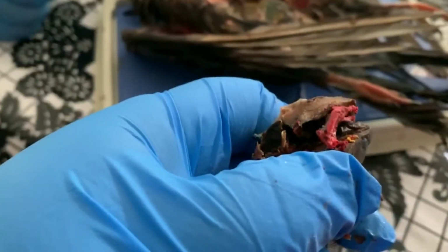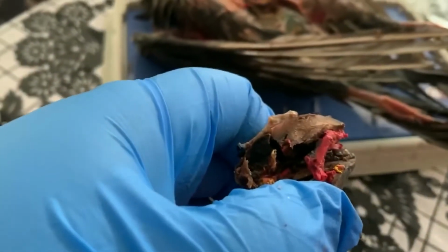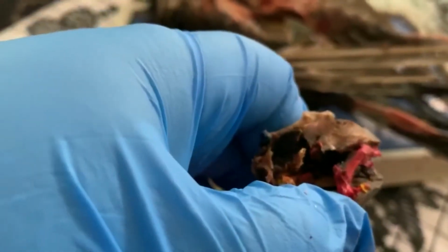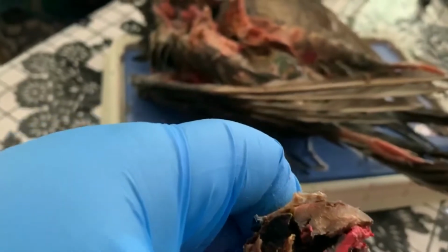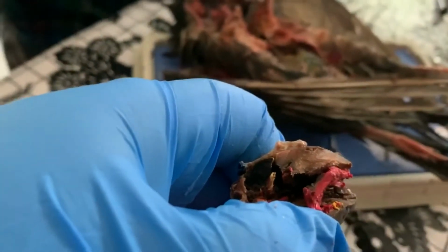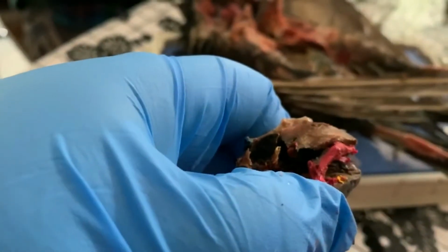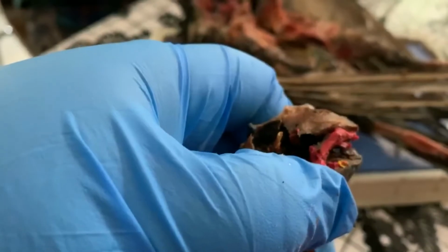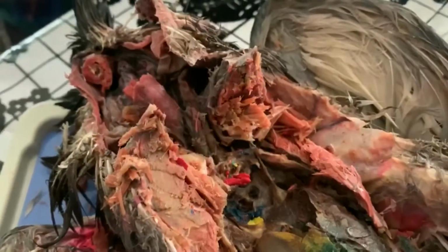All right, so just to review, it's perhaps not easy to see, but you can see here that there's a chamber at the top and a chamber at the bottom. These are the left atrium on the top and the left ventricle on the bottom. We've got this main artery here that you can see right above my thumb. That's going to be the aorta. We also, as we cut out of the pigeon, severed through the main vein that comes from the lung.